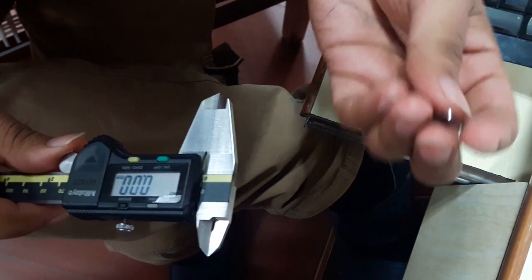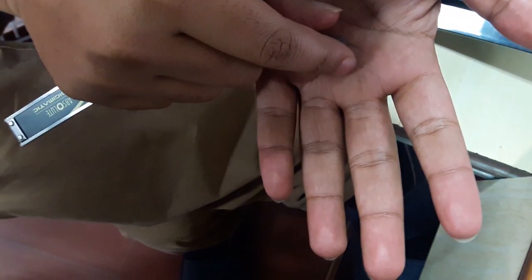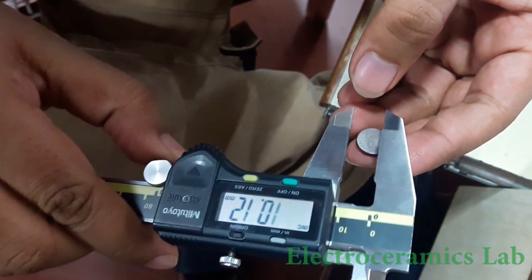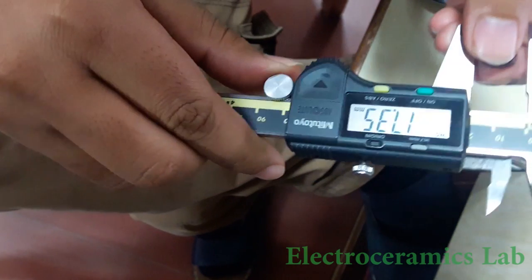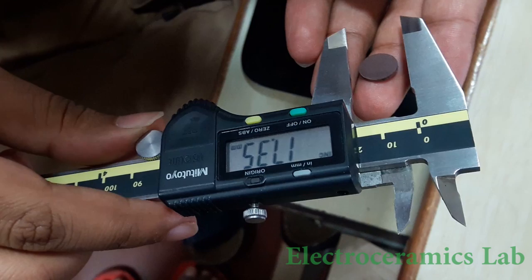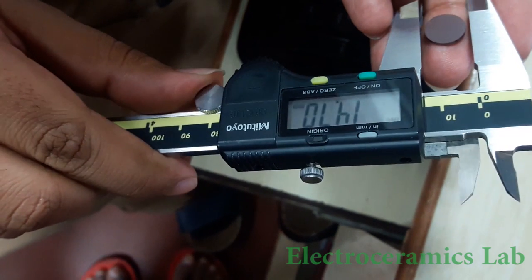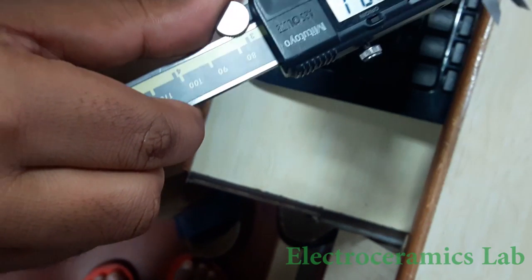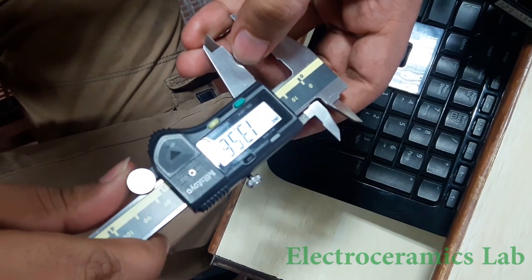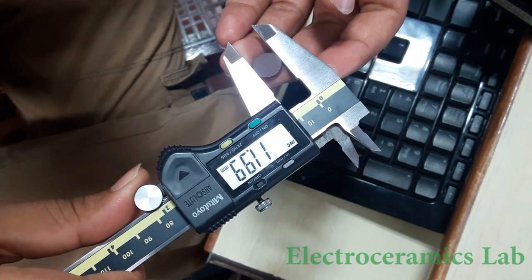For the measurement of geometric density, we need the weight of the sample measured by a weighing balance, and we need the volume. To measure the volume, we need to measure the diameter of the sample, which can be done using vernier calipers. Place the sample between the jaws; the diameter is showing 12.01 mm. Measure this diameter at different positions, at least three to four times, and take the average.